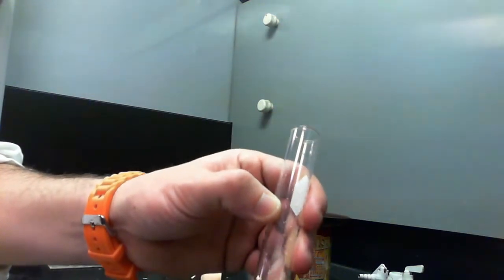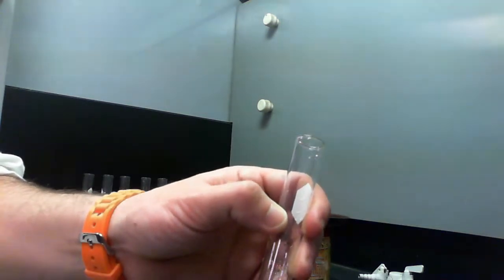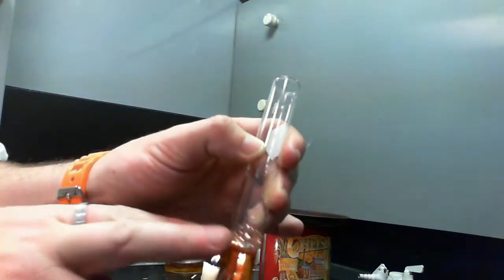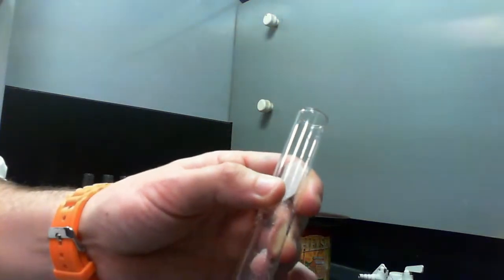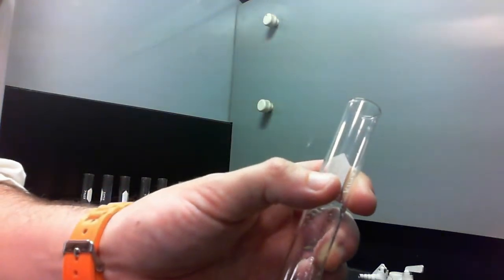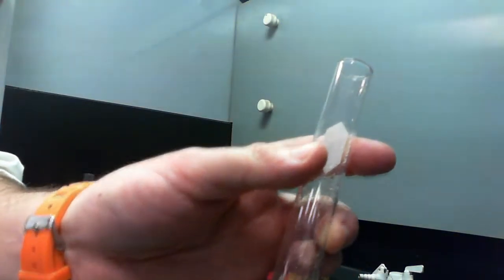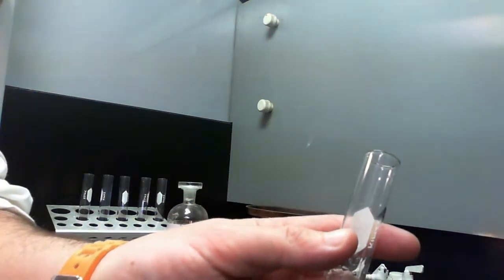And the reason for that is a substitution reaction. So substitution in sport is where someone is taken off and then someone else is put on in their place, yeah? Same thing is happening. In this top layer here, and it will take a while, it won't happen in the length of this video, hydrogen atoms are being removed and bromine atoms are being put in their place. So it's removing an atom to put another one into place. So it's what we call a substitution reaction.